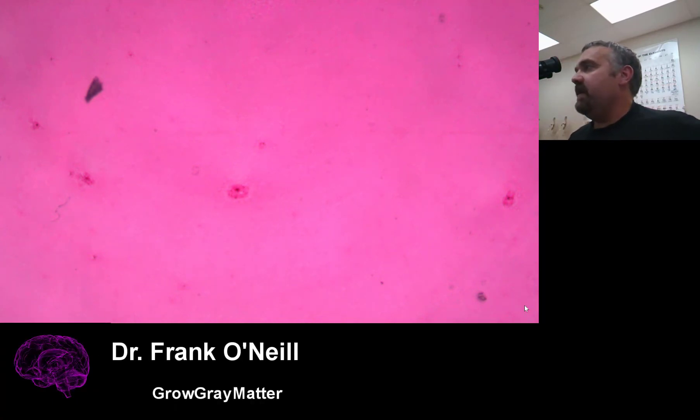All right, hello everybody. So my trusty microscope Skeeter and I are going to show you a capsule stain today.